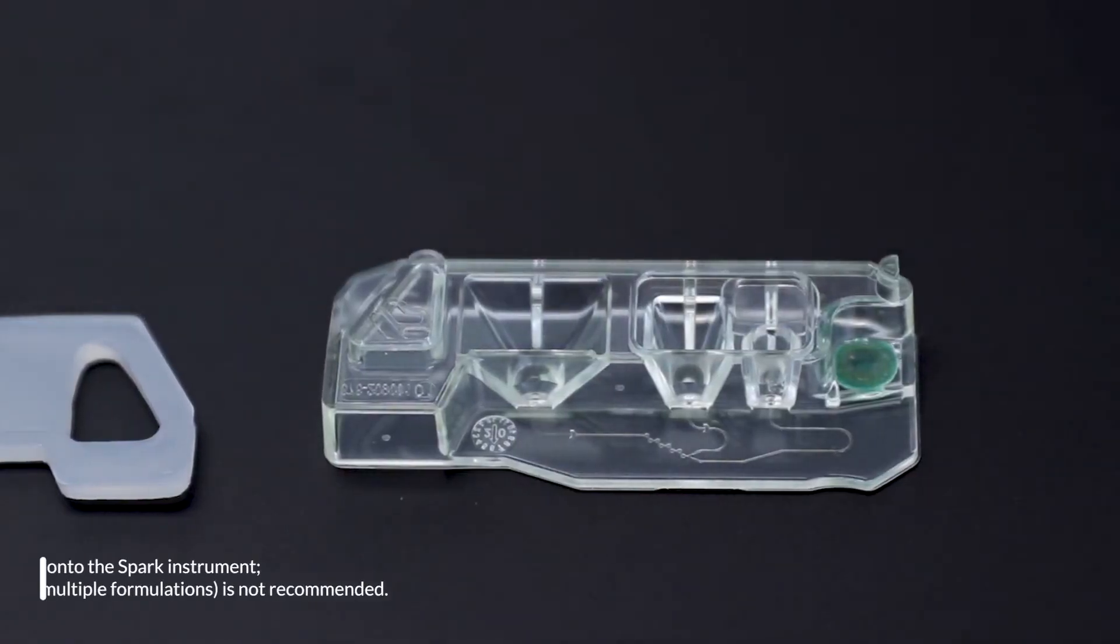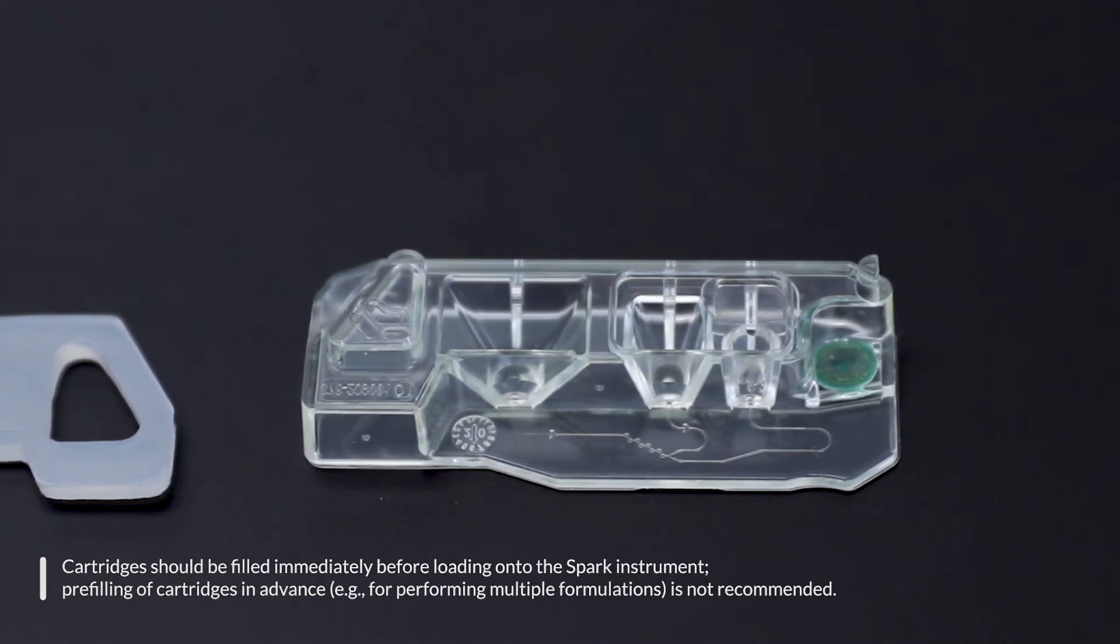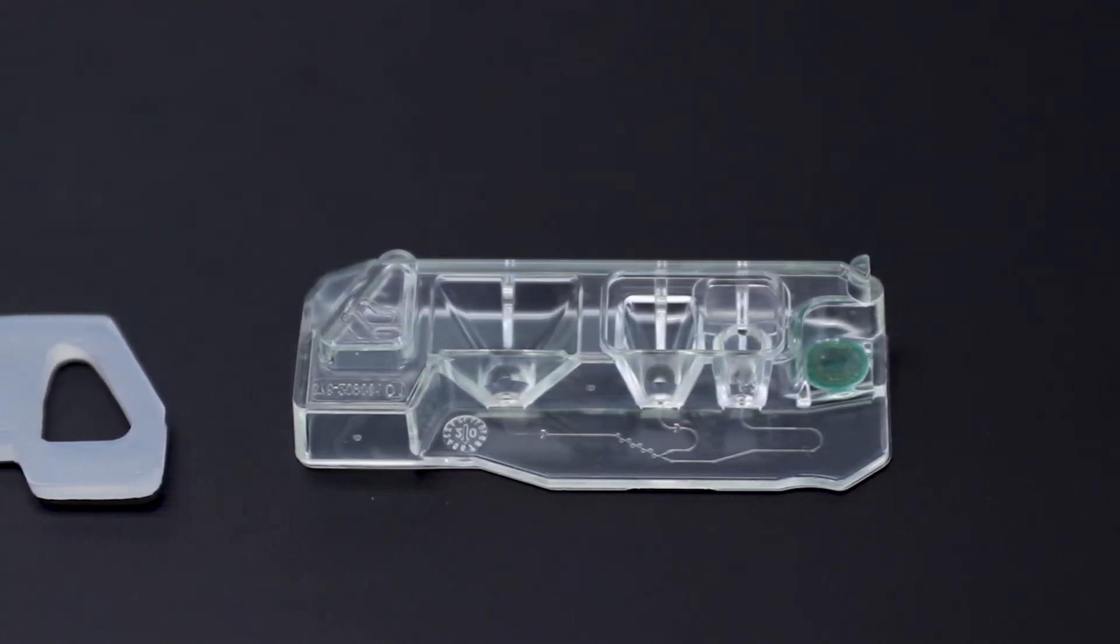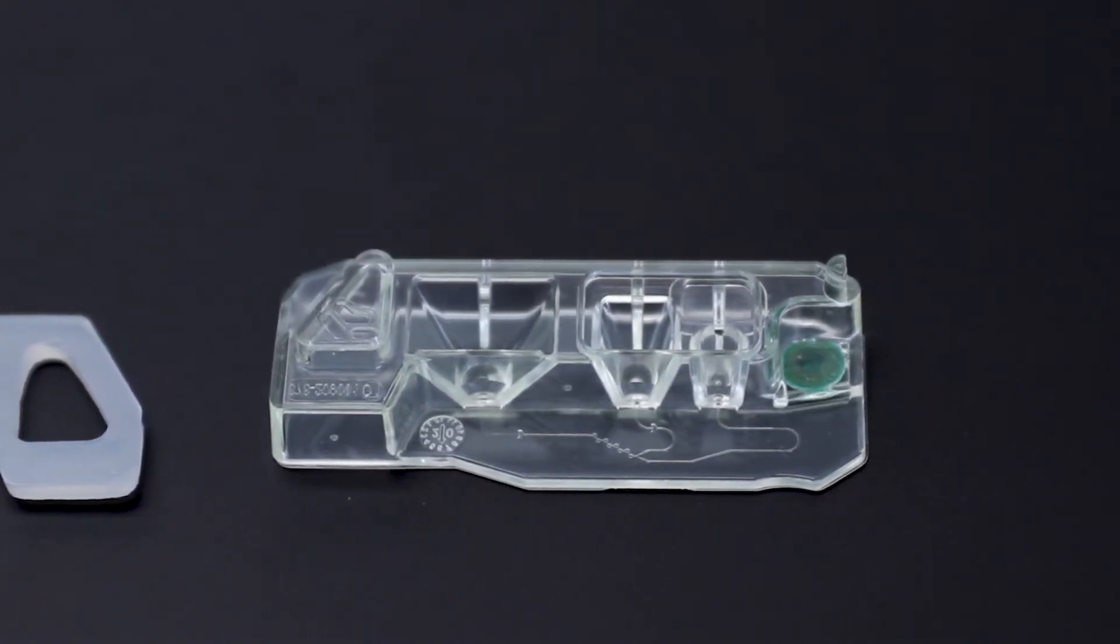Cartridges should be filled immediately before loading into the Spark instrument. Pre-filling of cartridges in advance is not recommended. After pipetting all components, check for any bubbles that may be at the bottom of the inlet wells, and if present, use a sterile needle to remove them.